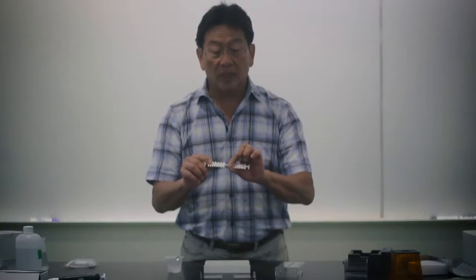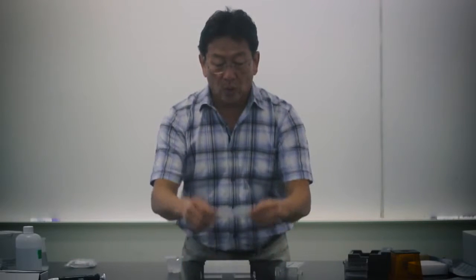The other thing about this comb is that the two ends are different, so you can only insert it into the casting stand one way. The reason is that these combs are actually beveled — they taper so that the opening of the well becomes much bigger, making it much easier to load without sacrificing the sharpness of the band. You always want the bevel facing out in the direction of migration, which is why the combs can only go in one way.